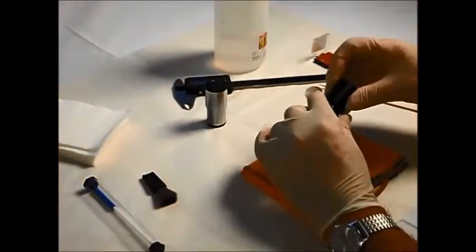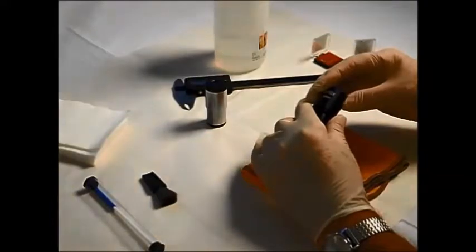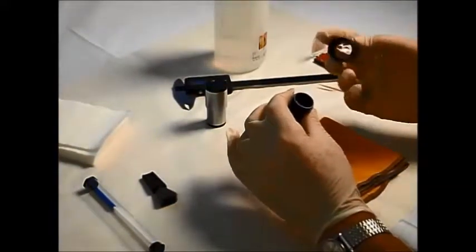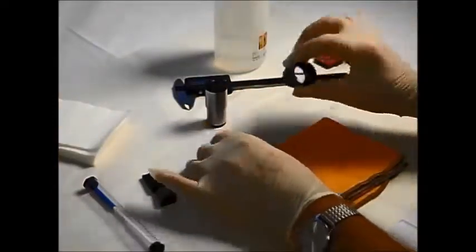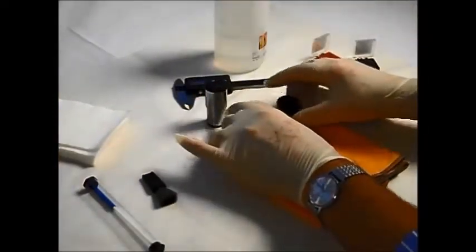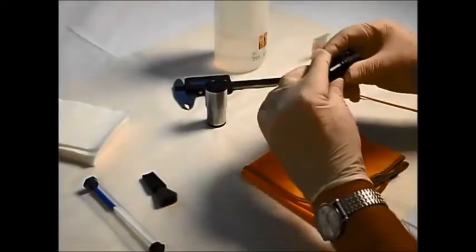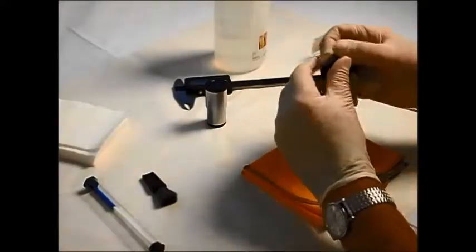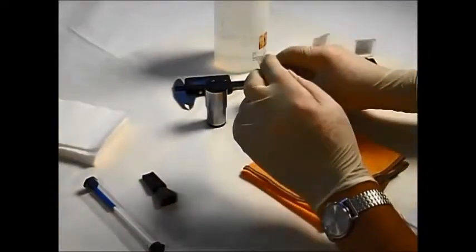This debris is now trapped inside the completed assembly and it can't be removed. Even if it's slightly out of focus, this can be a nuisance. So remember, do clean the eyepiece components once disassembled. A new reticule will come from the factory, clean and in a lint-free wrapping. So if opened carefully and handled with gloved hands, it shouldn't be too much of a problem.